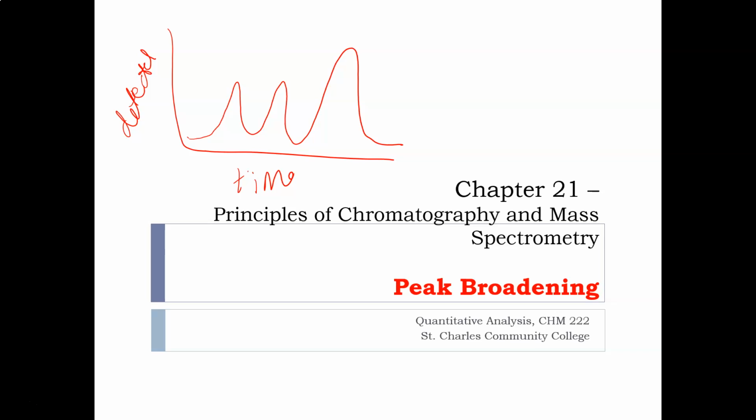So in the previous video, I mentioned that the more narrow the peak, the better. That we have better resolution. If they're narrow, that's the gap. It goes all the way down to the bottom before another peak happens. And so broad peaks, like this one's not that broad, but this one right here is pretty broad, is not ideal. So we're going to look at why are some of them narrow? Why are some of them not? What are the circumstances that go into that?